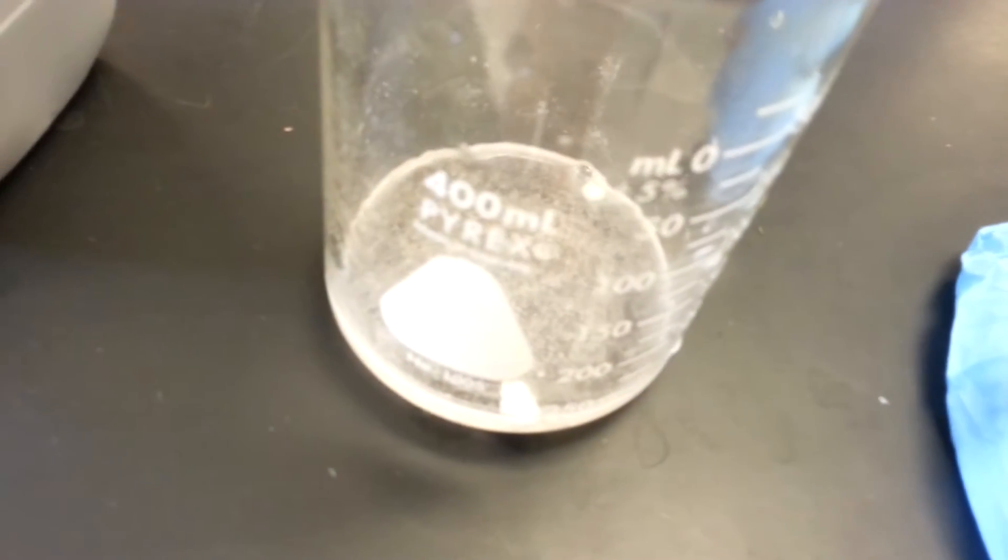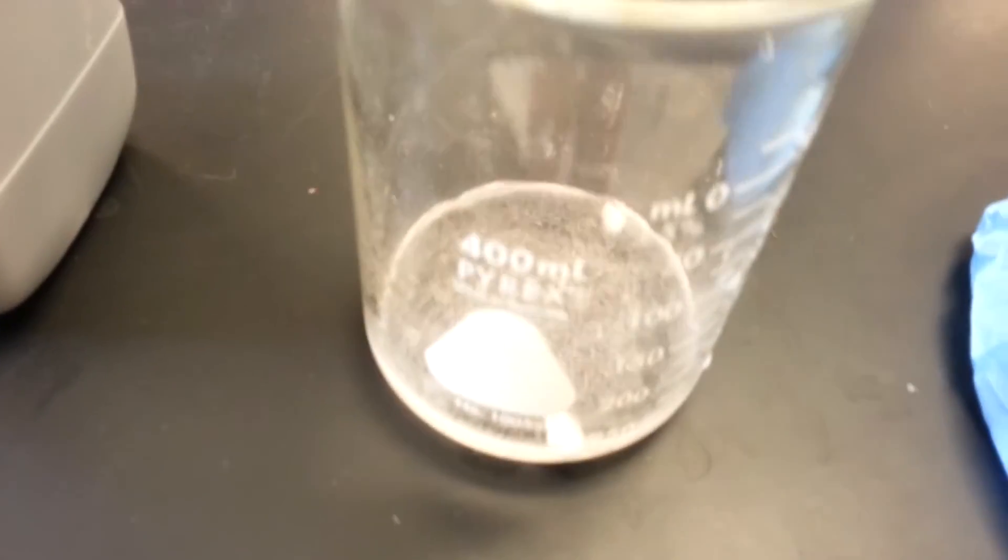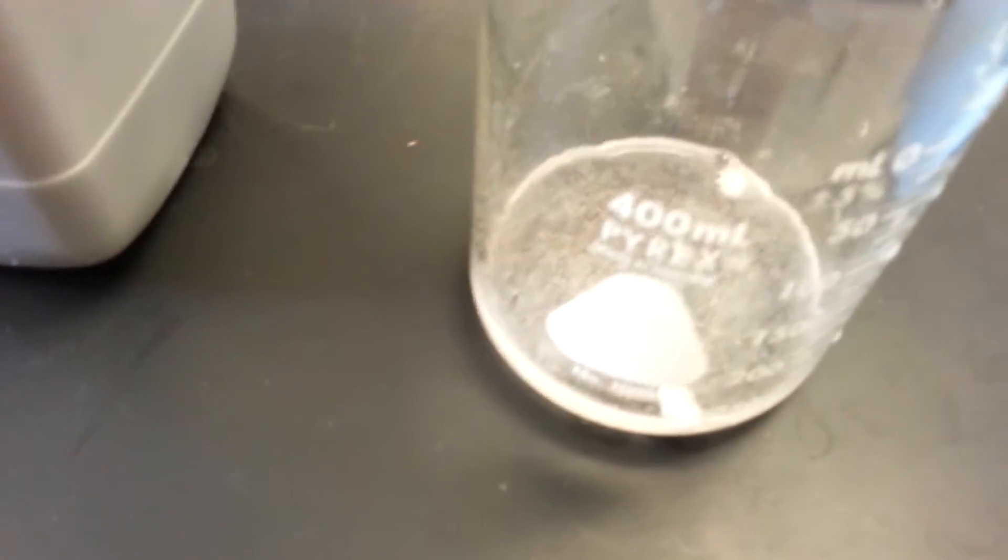I'm not going to add more sodium bicarbonate, but that's basically how you do this. You cannot pour your acids and bases down the drain. It's just not the smartest thing you can do.